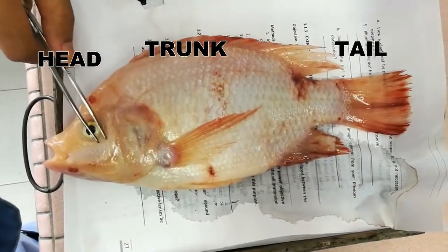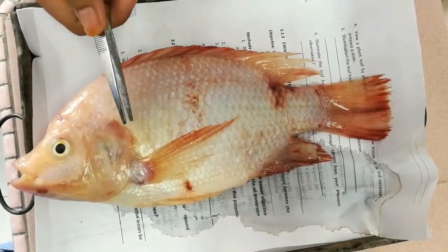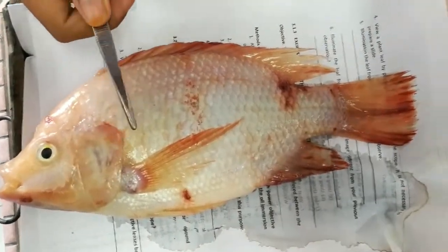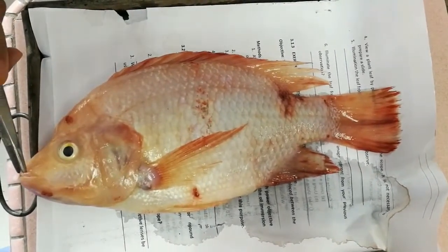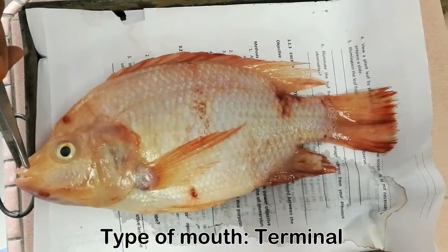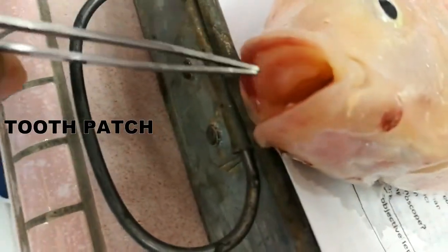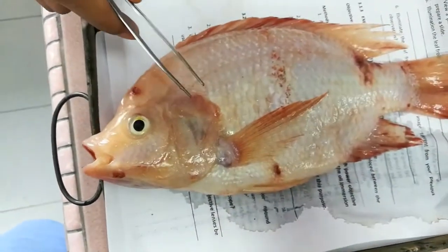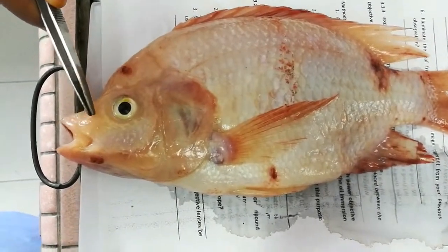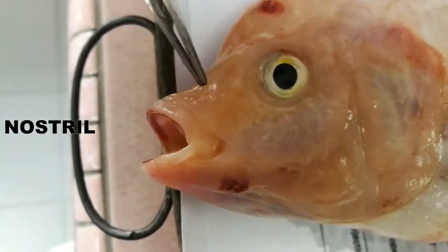The head is the region from the anterior most of the snout until the operculum. The head consists of a snout or mouth. Tilapia fish has a terminal type of mouth, and you can see inside the mouth there is a tooth patch, which is for feeding. Tilapia fish also have a nostril, a small hole near the mouth.